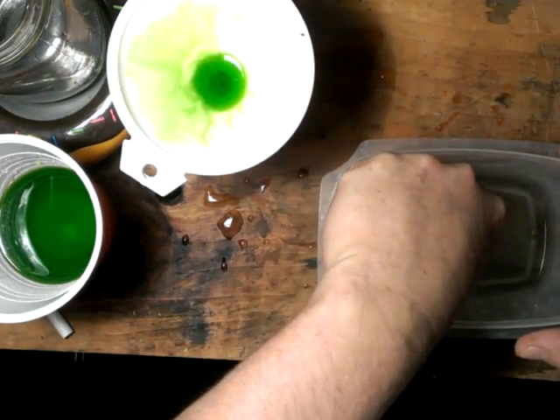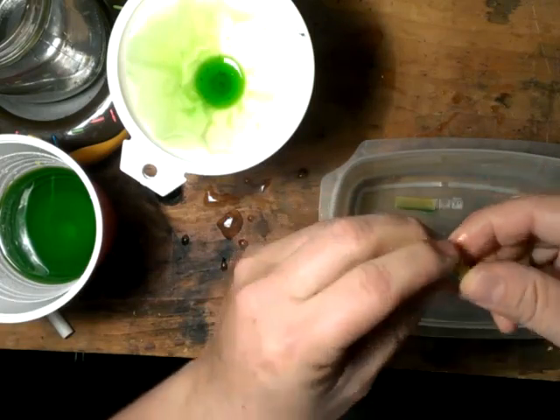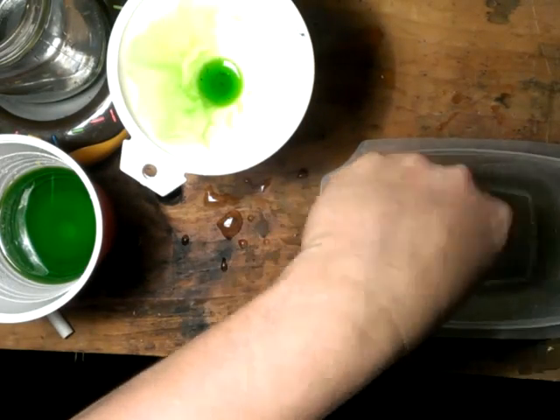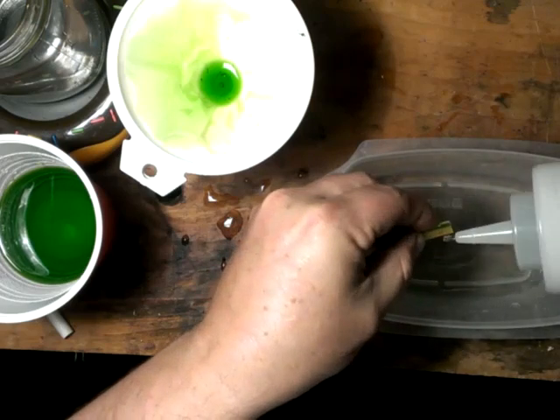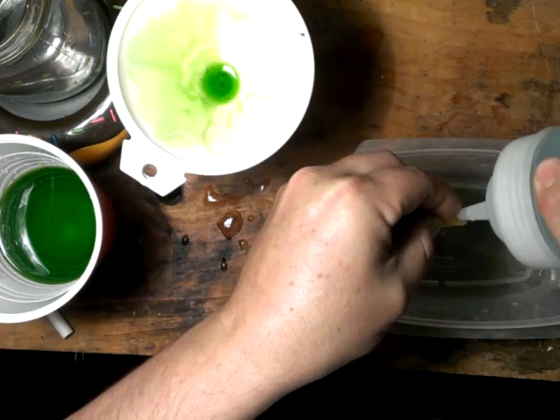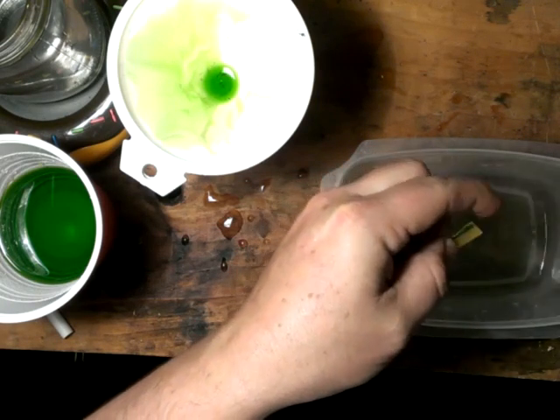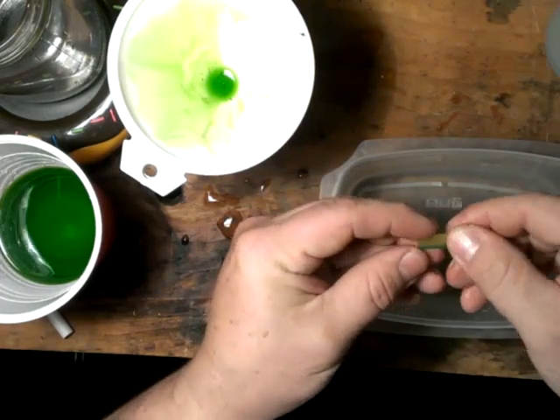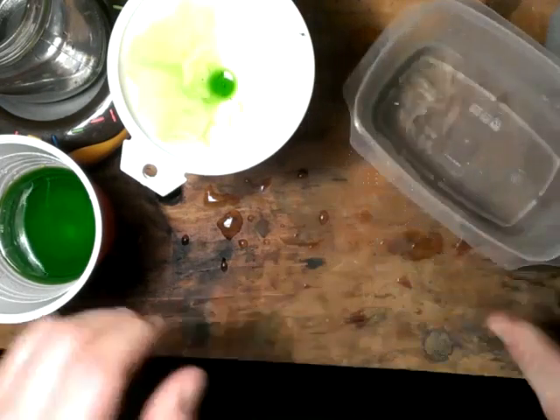Now these are the last two fingers — pieces that were left. You can see it's all cleared off completely. Nothing left, just how we like it. One little spot there — let's see if we can get this cleaned off. And that's it, that guy is completely clear. It looks like we got everything off of there that we possibly could.